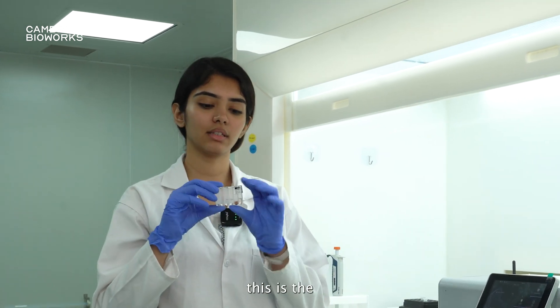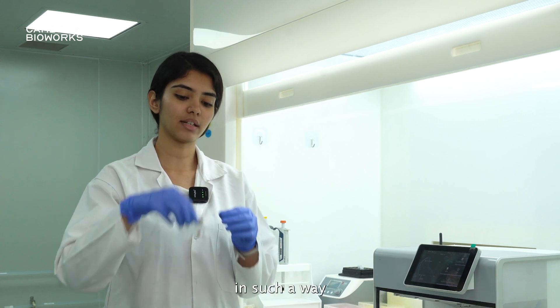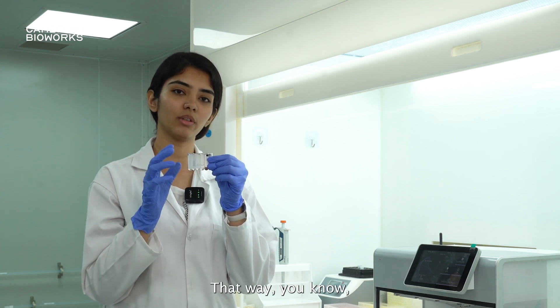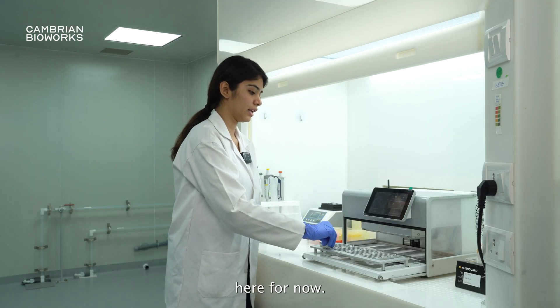As I've mentioned earlier, this is the pre-filled cartridge, and before using it, we recommend you shake it in such a way that whatever might be stuck on the seal on top will come to the bottom. That way you know that all of your buffer is at the bottom and not stuck on the seal when you remove it. I will place it here for now.